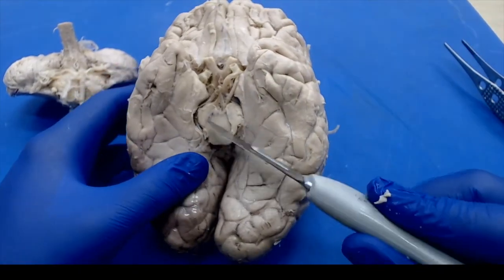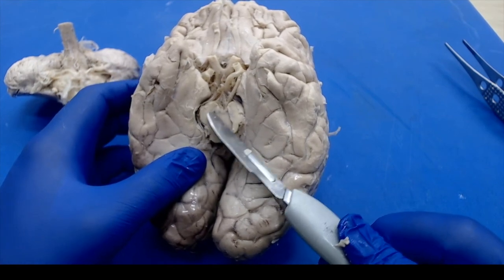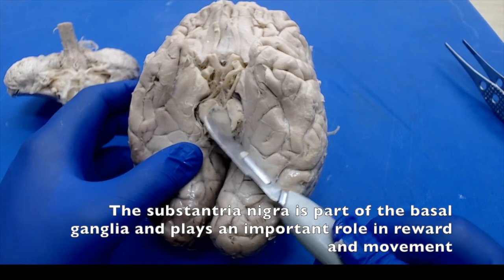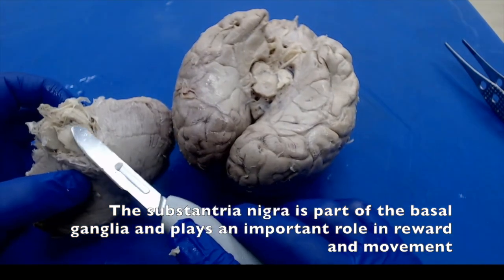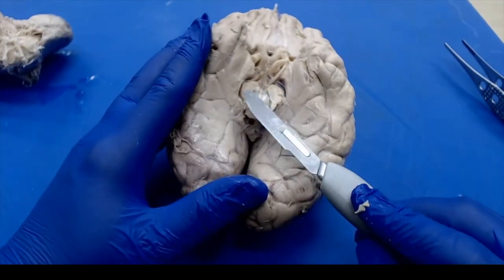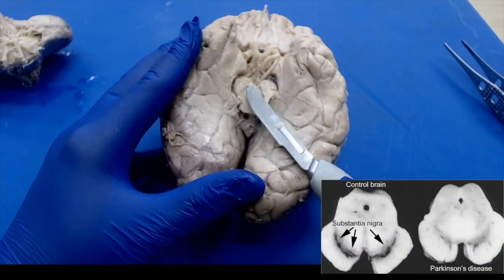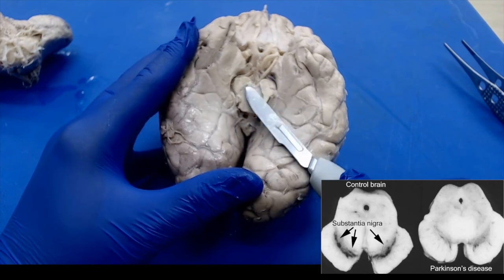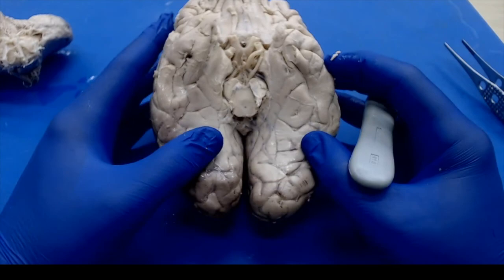Now, the thing that should stand out to you if you do this section correctly is this brown discoloration, which is a very characteristic pattern in the substantia nigra. Now, when you take your sections, and you'll also be able to see this on your brainstem typically, we want to take a section of substantia nigra in order to rule out things like Parkinson's disease. In Parkinson's disease, we'll see actually a discoloration of this. It'll look a little pale. You might not see any brown discoloration at all. The brown is actually due to dopamine generation. So we see it looks good.